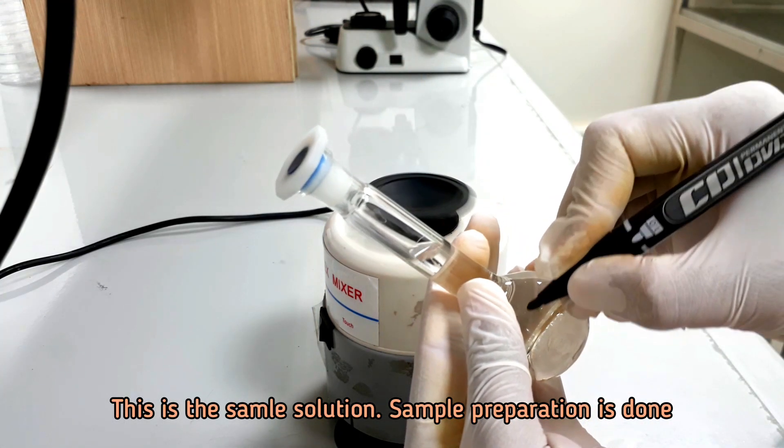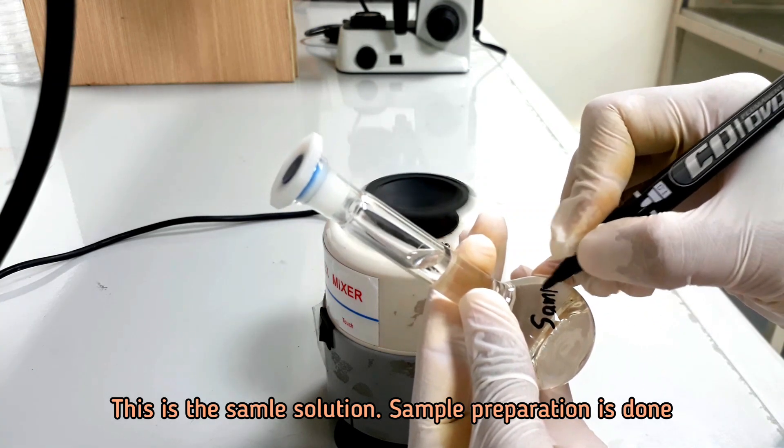Sample solution is now ready for taking the absorbance using UV spectrophotometer.